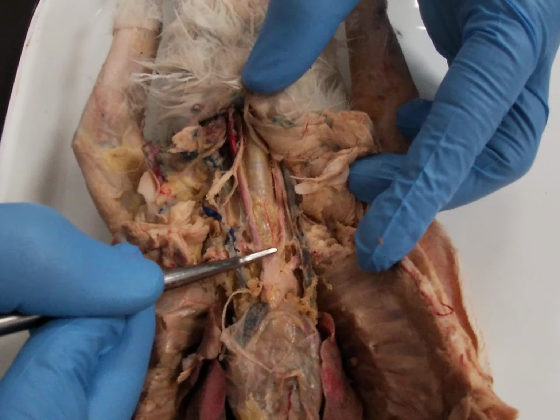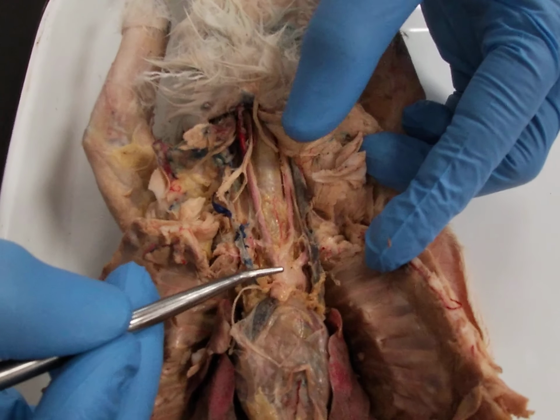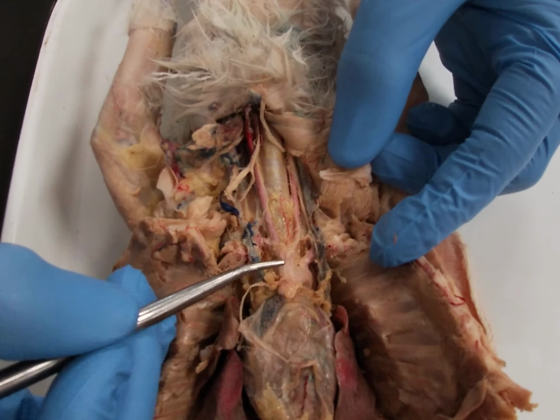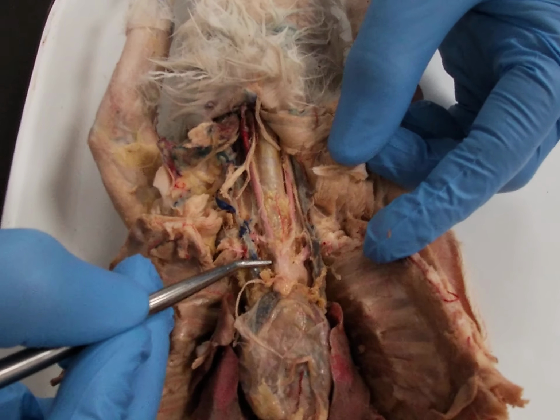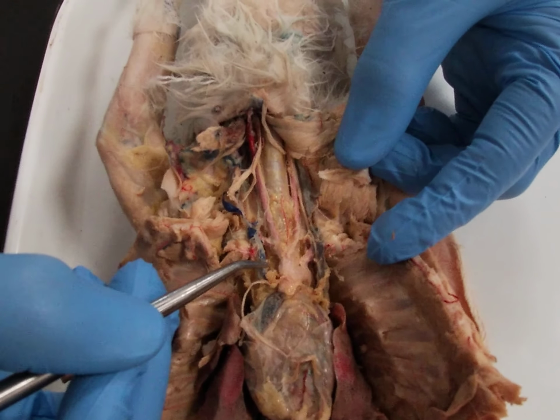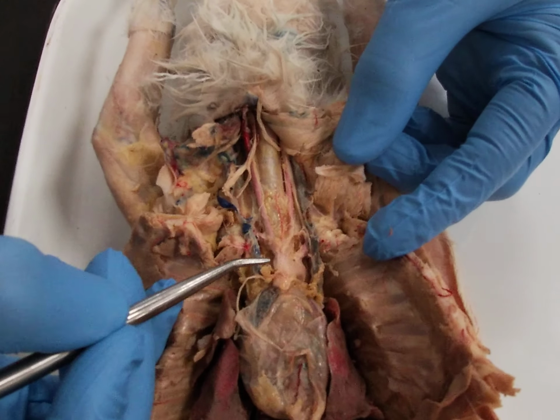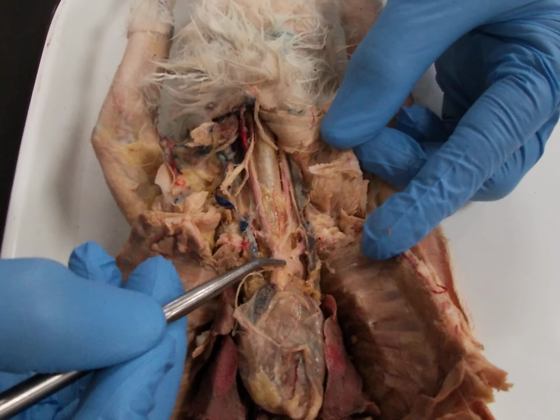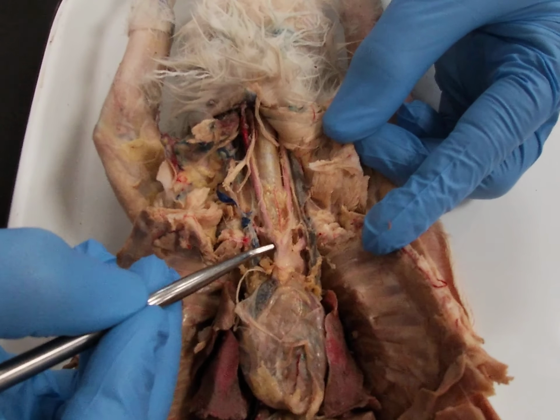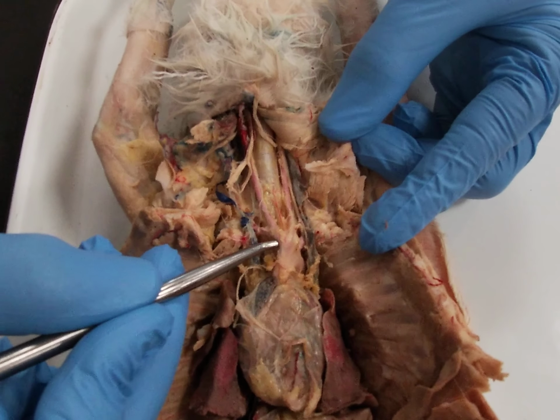And coming off the aortic arch, we have two primary blood vessels taking blood up to the head, the neck, and the upper torso. In the rabbit, as in most mammals, there are two major blood vessels coming off the aortic arch. But if you recall, in humans, there are three blood vessels. So this is the rabbit, and again, this is the aortic arch. So we will count this first blood vessel here is this broad blood vessel called the brachiocephalic trunk.